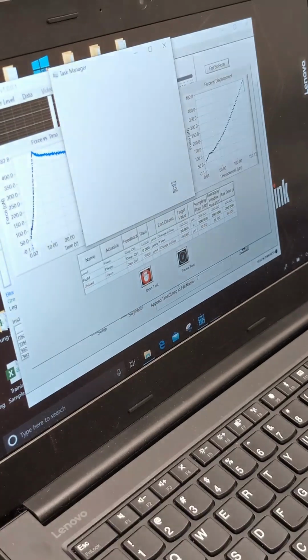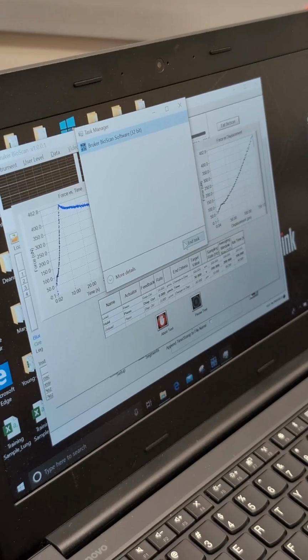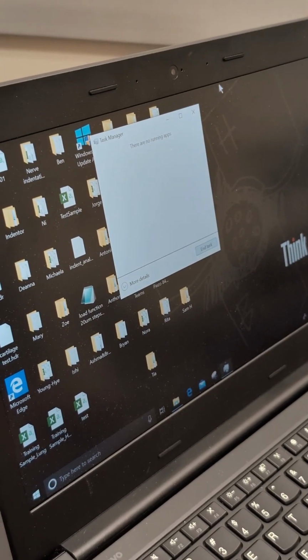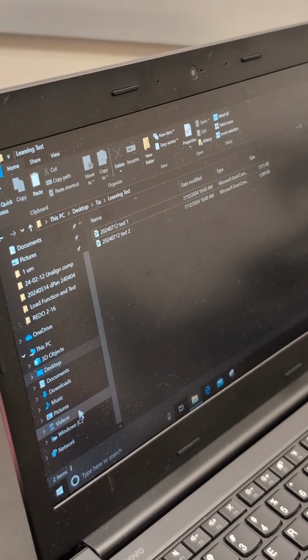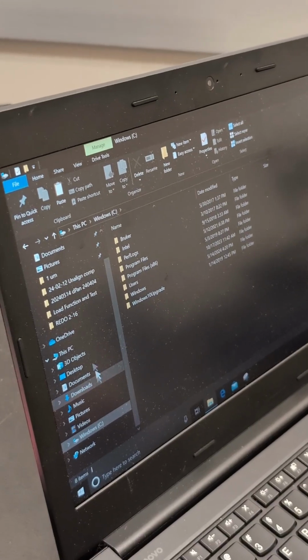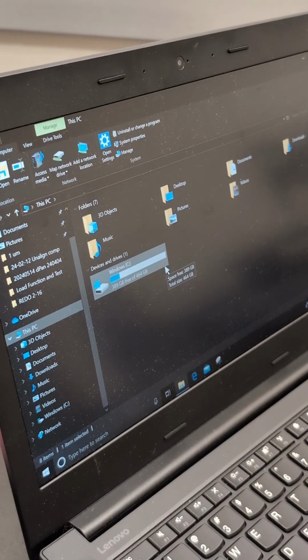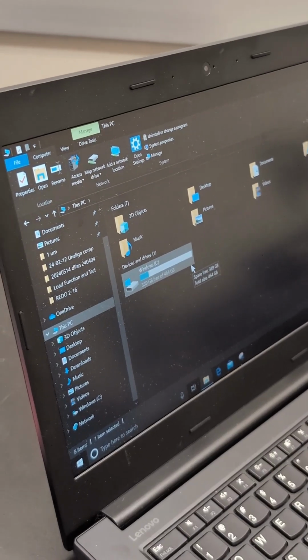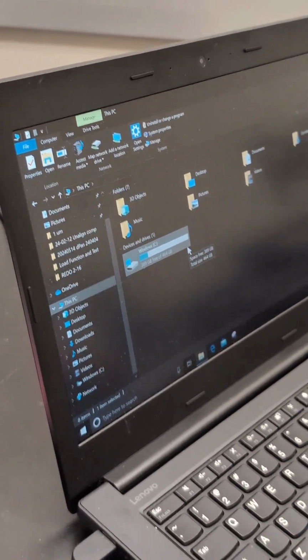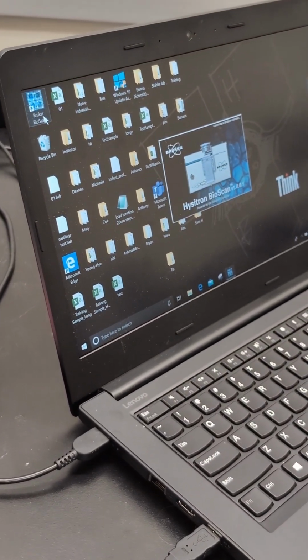I was thinking the computer is maybe just completely full of temporary saving drive, but that's not the case. If you just take a look at the actual computer setting itself, This PC, it has more than enough space. So I have no idea, and I don't have a way to solve it. The only way is a hard reset. So basically, just reset the software again.